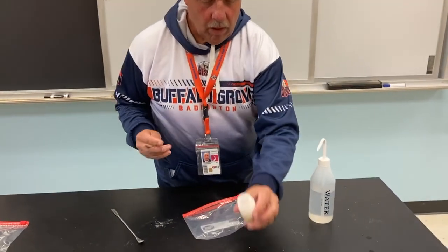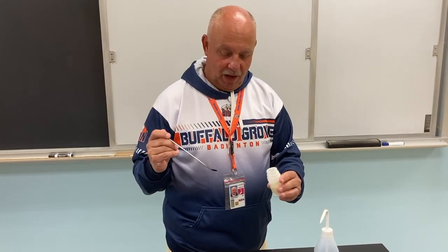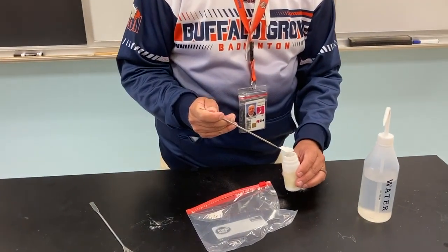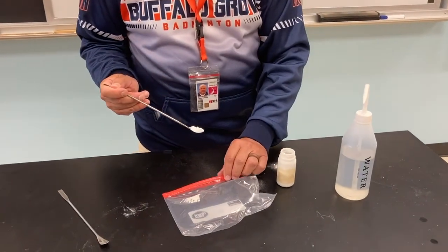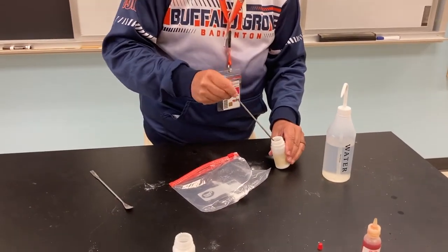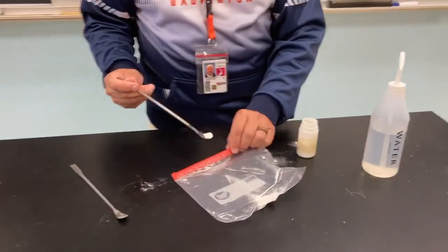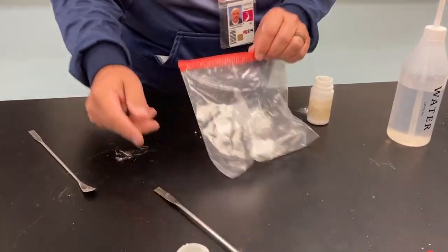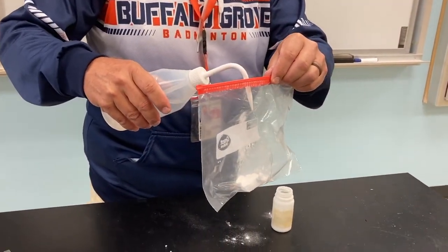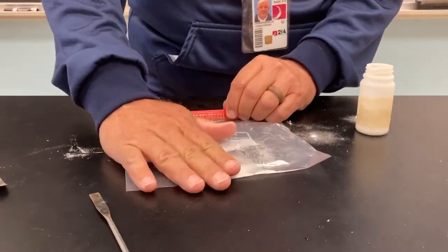What are you doing now, Mr. Van Grandel? Okay, so we're gonna take the sodium bicarbonate and put it in there and try to, again, isolate to see what's going on with just the water. Let's get a little more. Mama always said if something's good, get more of it. All right, so we'll take the water with it, find out what's gonna happen. I'm gonna squeeze it out to try to get rid of everything.